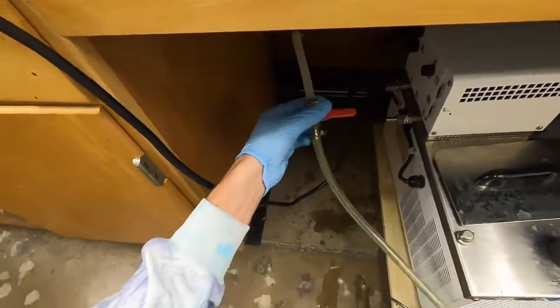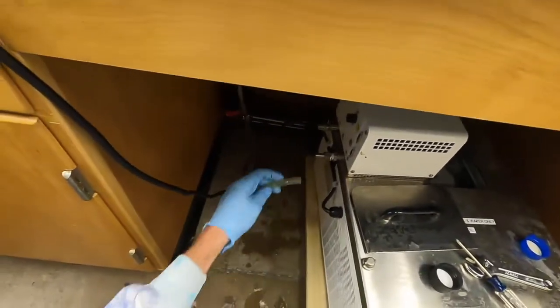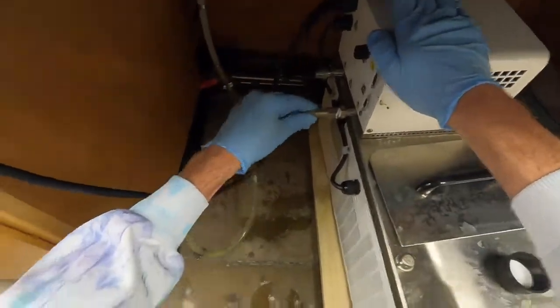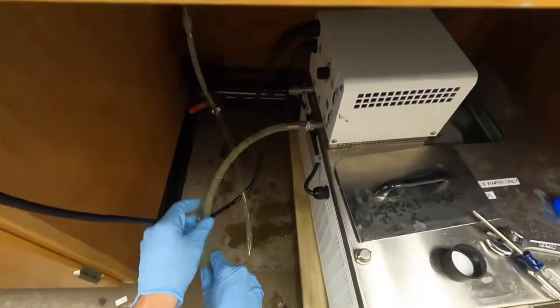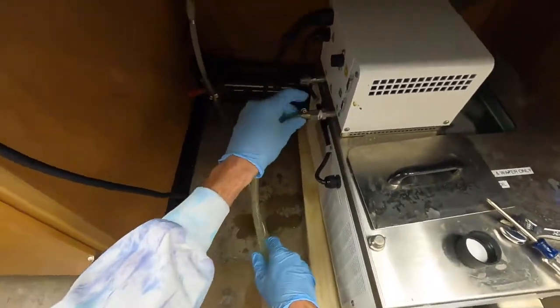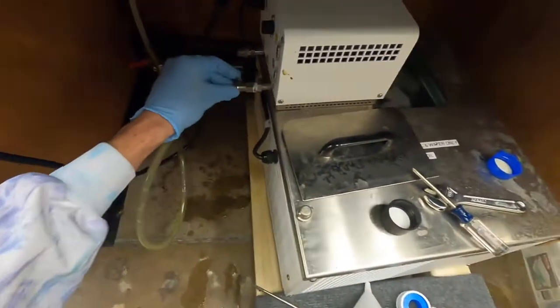Once you're done draining, you close this valve back off. Then usually I just put this back on here and bring this clamp that we loosened earlier and tighten it back on. I like to reset it so that when I come back to it to fill it up, it's ready to go. I don't have to change any of this.